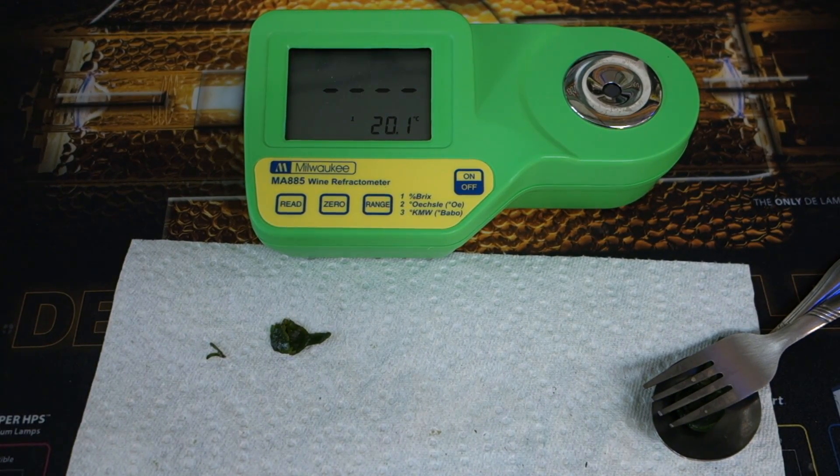And 6.9 on the organic. So we've definitely learned something today when it comes to measuring Brix. I'm going to show you a few things we're going to do to improve the Brix, and then in a few weeks we'll take some more samples and see how we're doing.